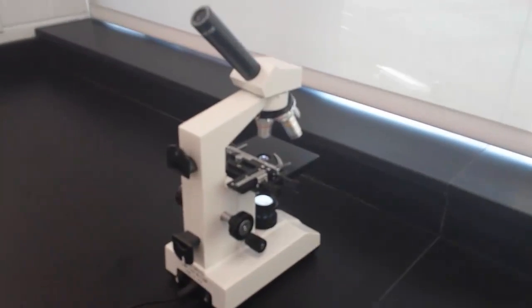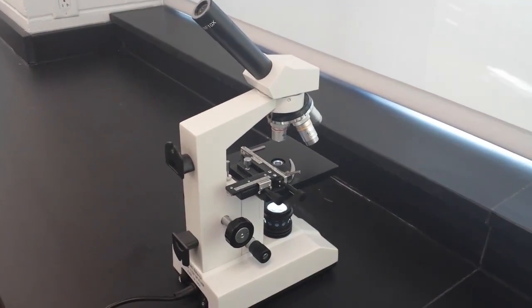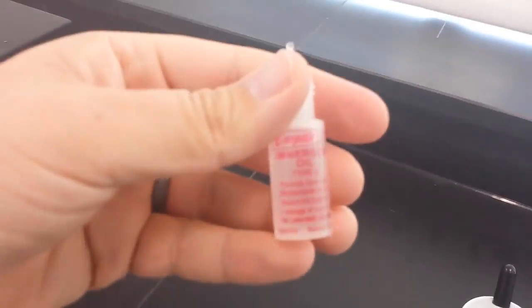All you need for this is a microscope, preferably one that goes to 400x. This one goes to 1000 power, however, and if you're going to use that powerful of a microscope, you're going to need some immersion oil.